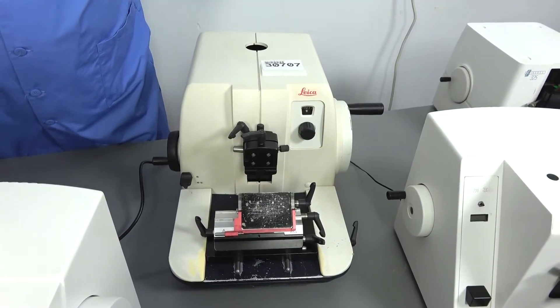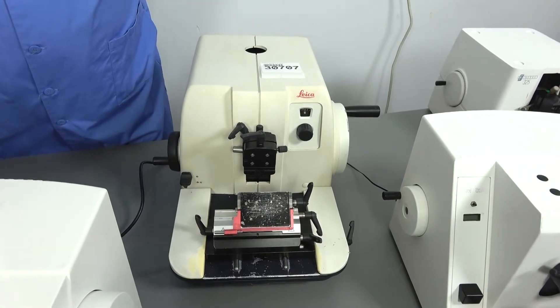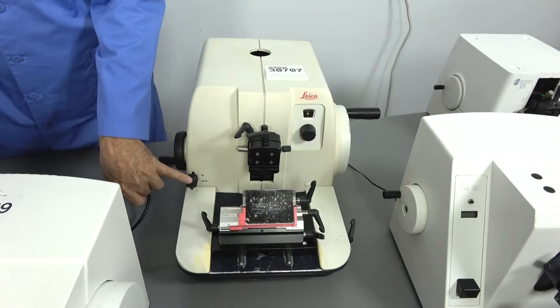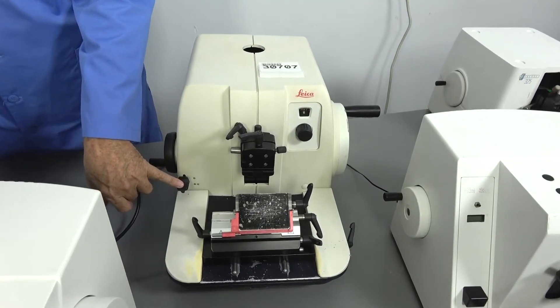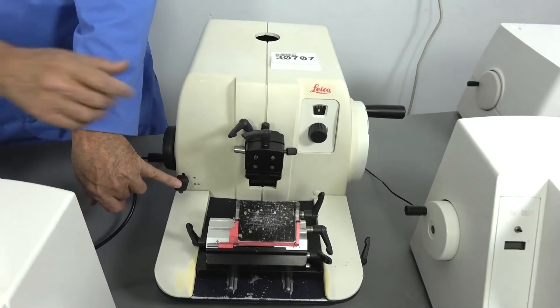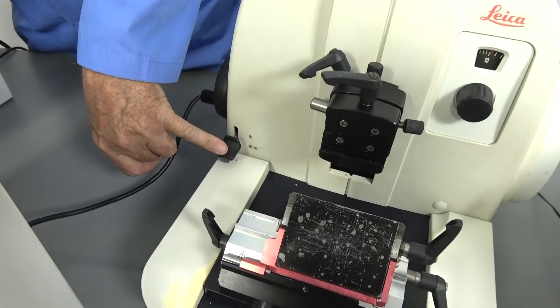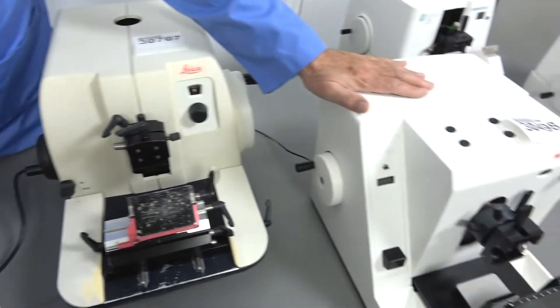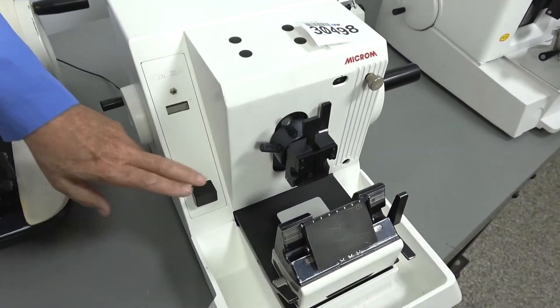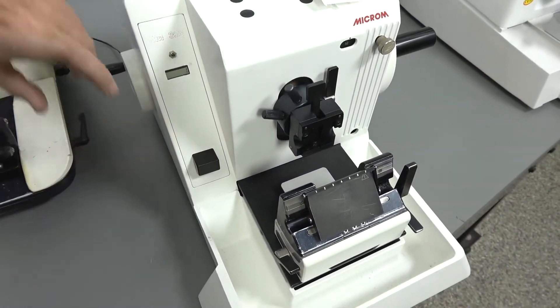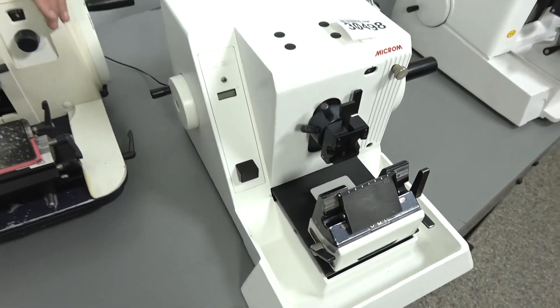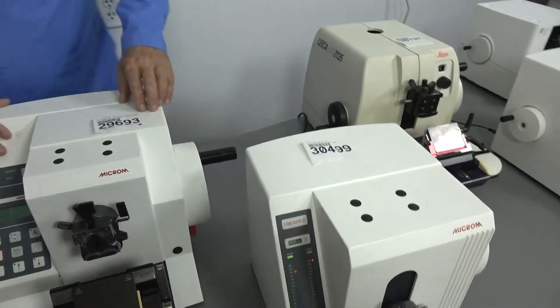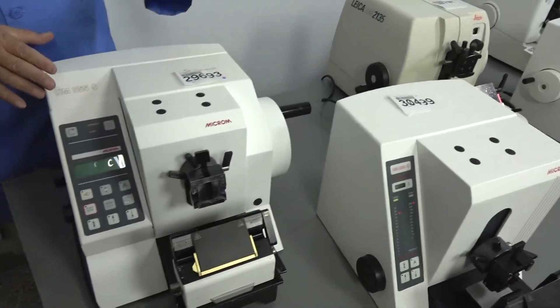In this machine, this is a dual position, so you push it down a little bit, it's a 10 micron feed, and press it down harder and it goes into the 35. Where on the model 325, it's a single and it's only got the one distance. But it is a nice feature when you want to move ahead in the cutting.